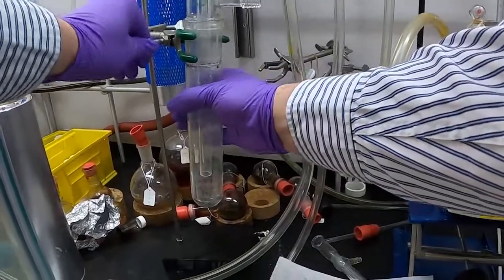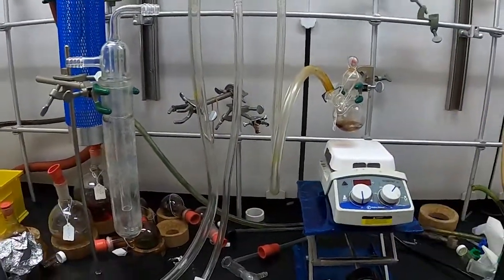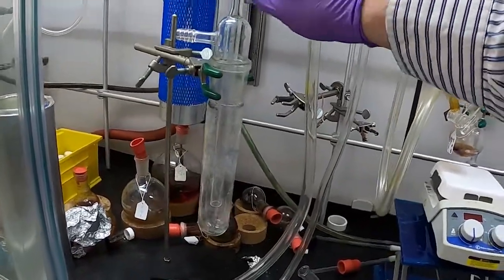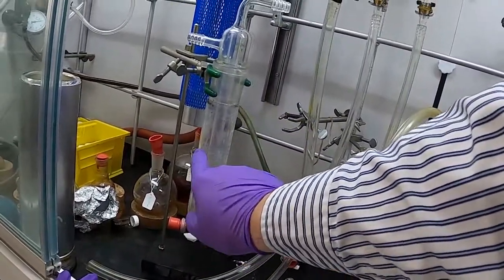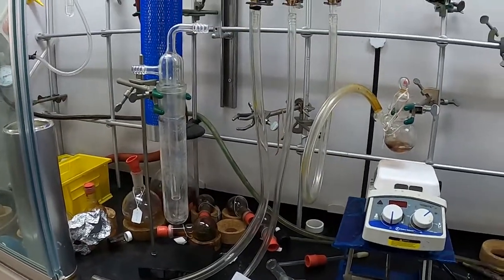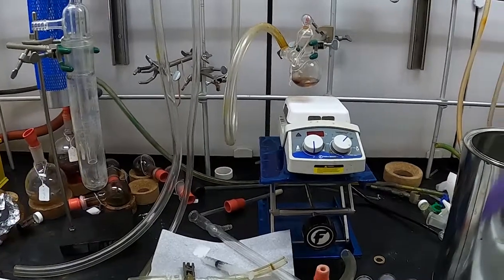We'll spin this around for this particular reaction because we have a little bit more than 10 milliliters in our reaction flask. We'll connect this directly to this other side here. This goes to the inside too, and then it'll collect out here. This is done to try to keep the trap from freezing shut as we collect in the trap.